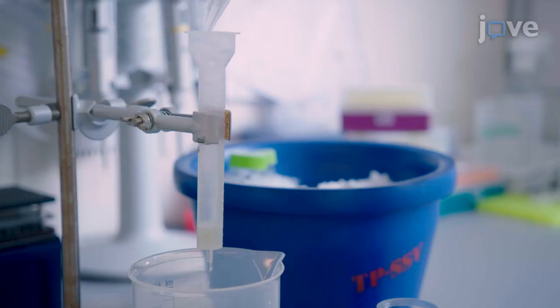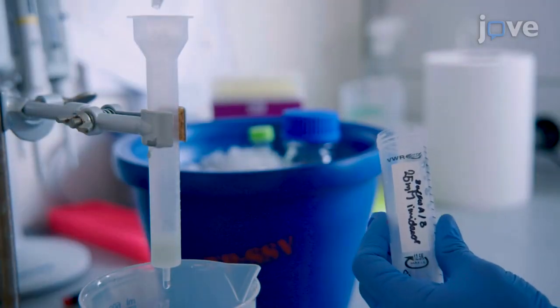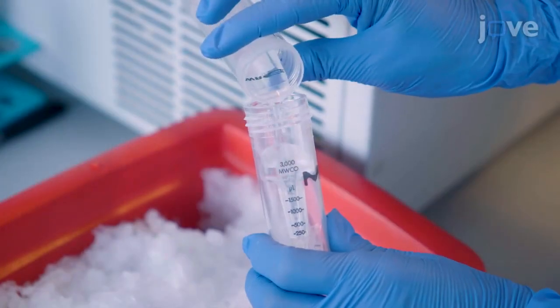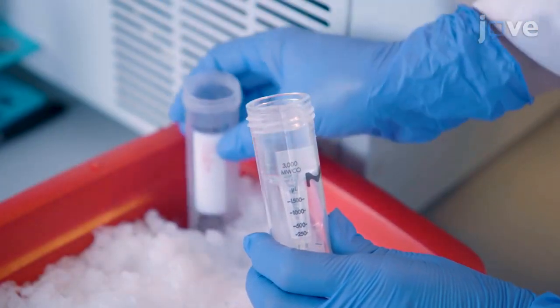This protocol for a recombinant cell-free protein expression system, commonly known as the PURE system, utilizes co-culturing and co-purification to streamline the required protein purifications. This significantly minimizes the time and labor requirements.